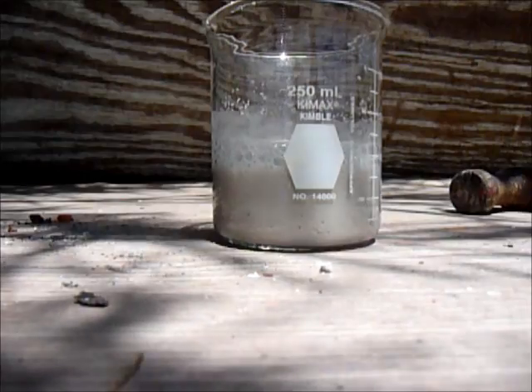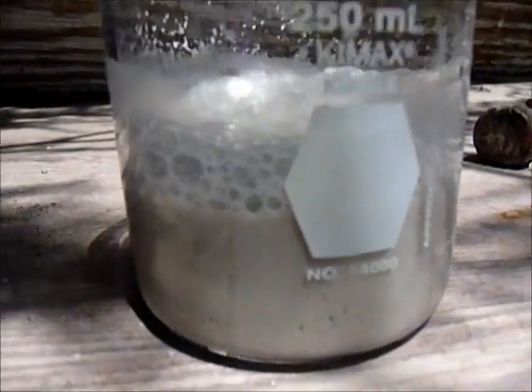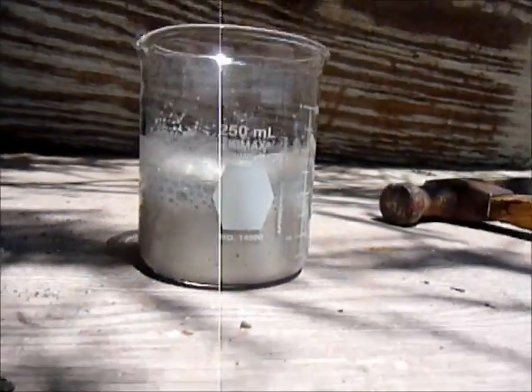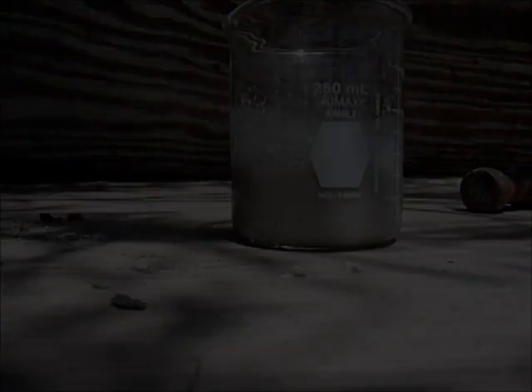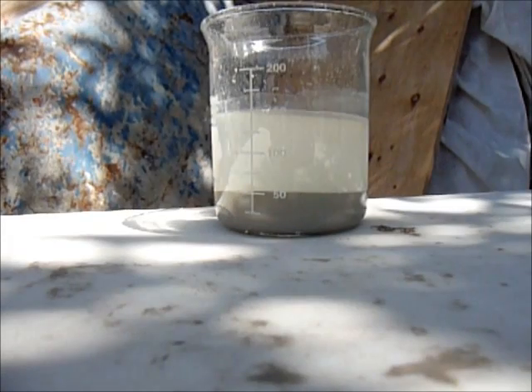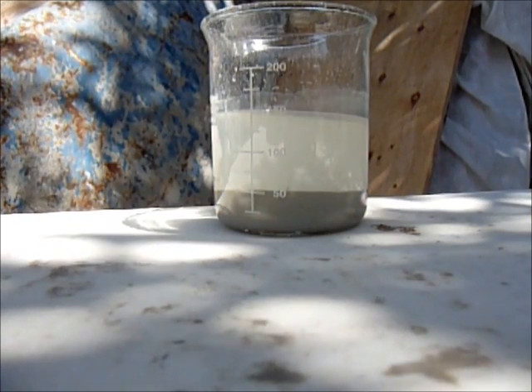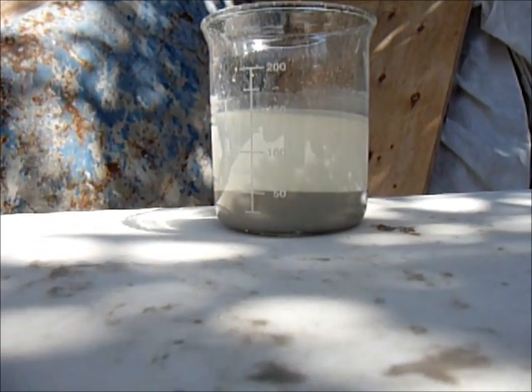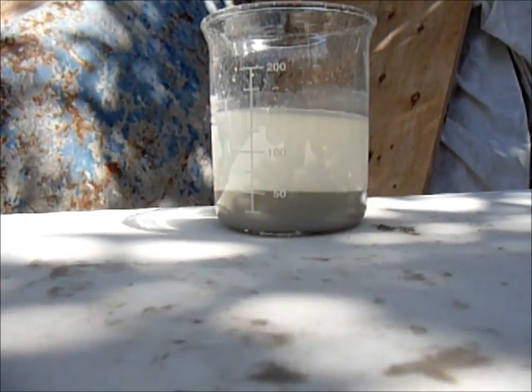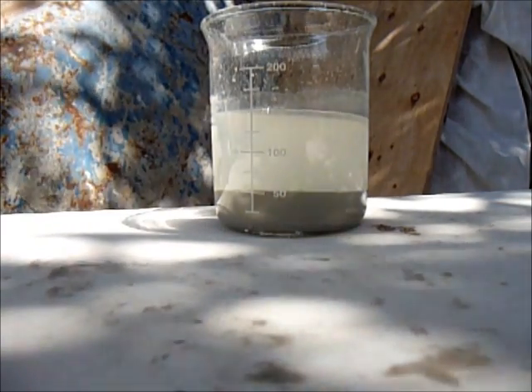I'm halfway there and you can see it bubbling hard. It has the same stink as hydrogen sulfide. It's been about one hour and you can see that it finished reacting. It's reacting very little. The next step is to decant all the water.